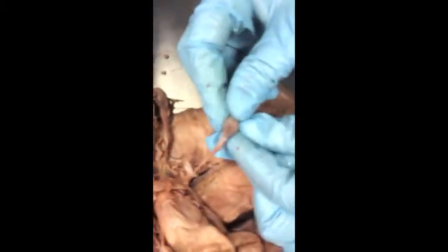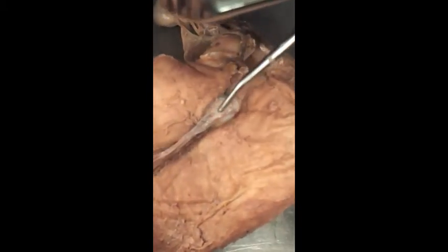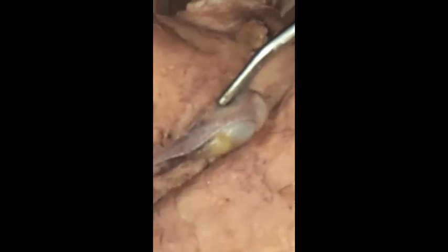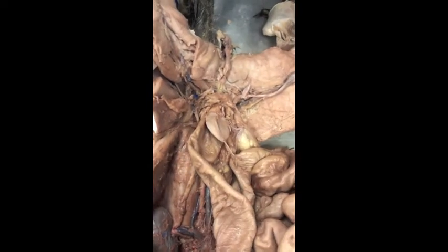Now this one has been opened up, and if you zoom in really close to this guy, if I can get it to sit still. If you zoom in really close on here, you can see all the little coilies within the tube, or the super coily tube within that, so that's basically your epididymis wrapping around here, and then coming up to give rise to your vas deferens, which is going to lead up and into the pelvic cavity.